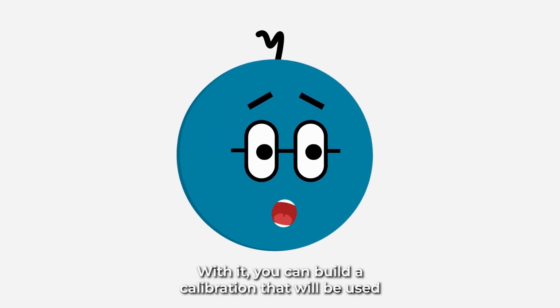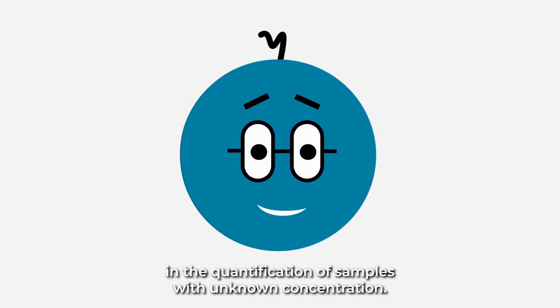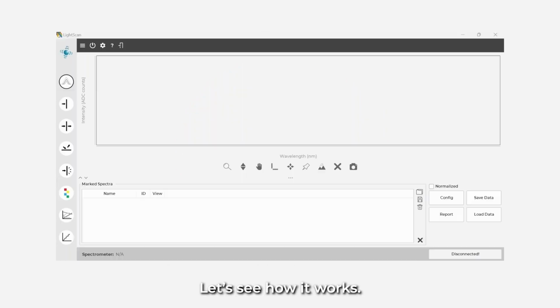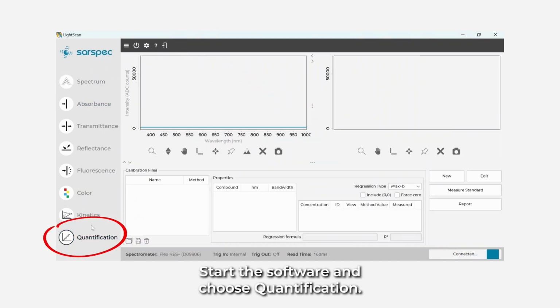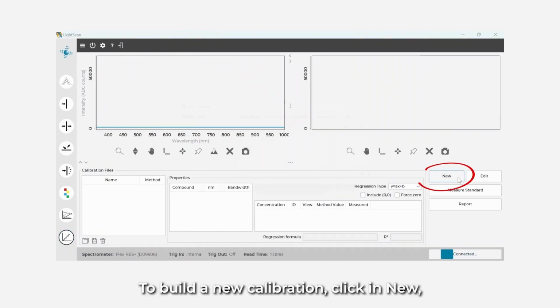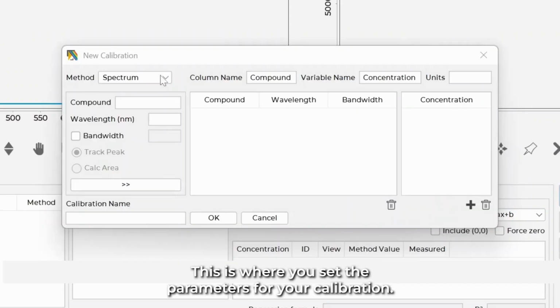With it, you can build a calibration that will be used in the quantification of samples with unknown concentration. Let's see how it works. Have your standards ready. Start the software and choose Quantification. To build a new calibration, click on New and it will open a new window. This is where you set the parameters for your calibration.